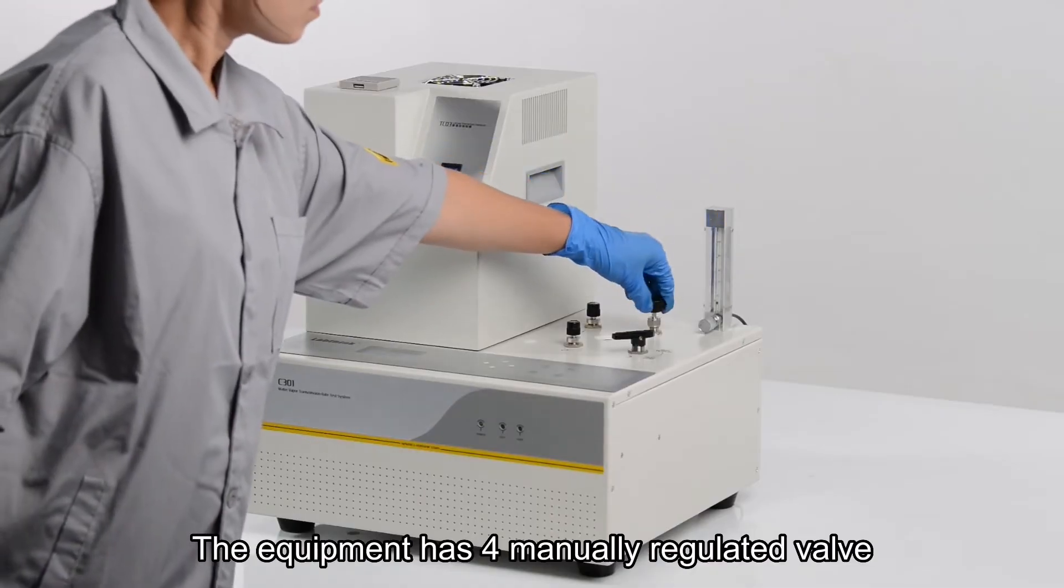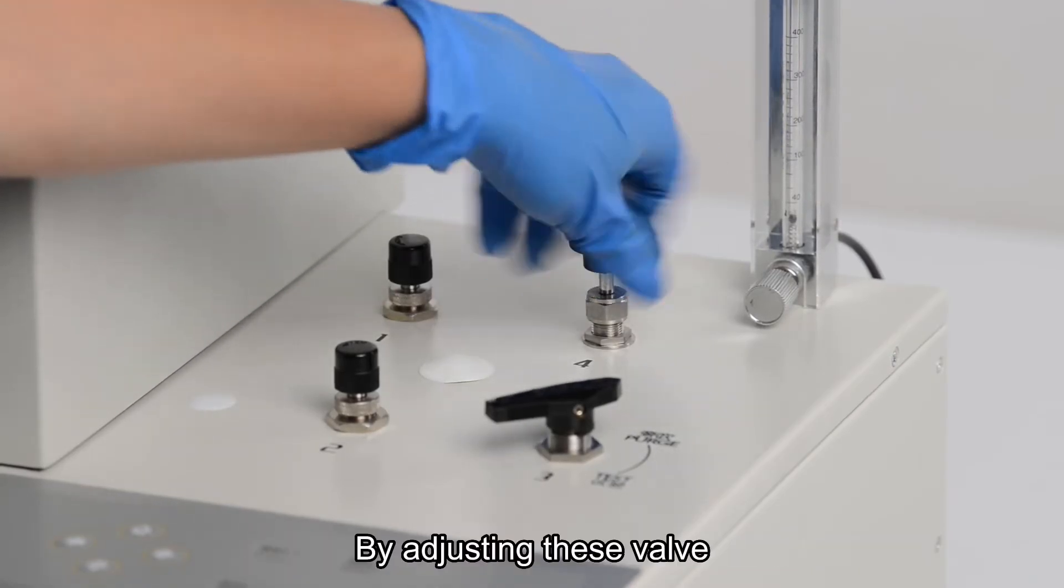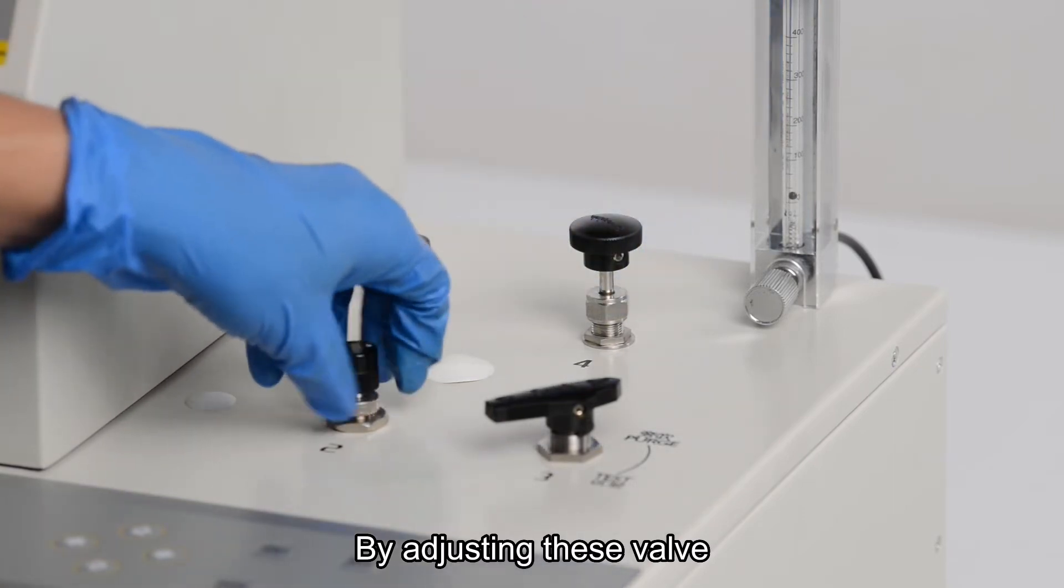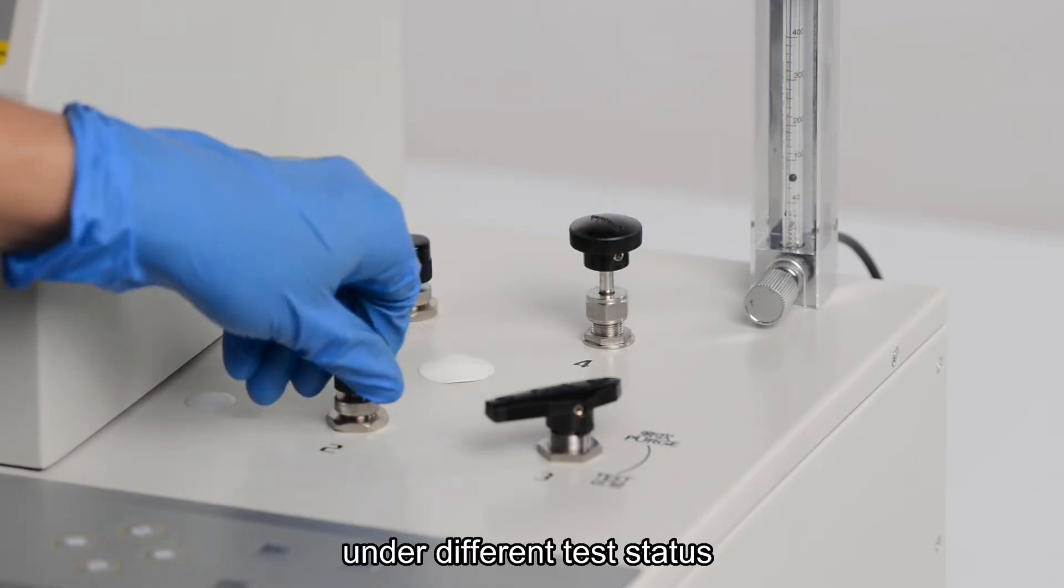The equipment has four manually regulated valves. By adjusting this valve, we can change the gas pipeline connection under different test status.